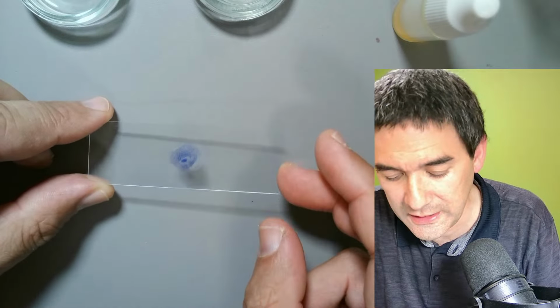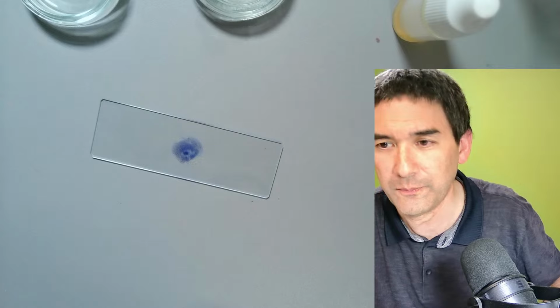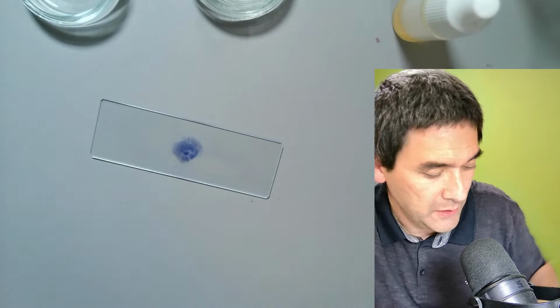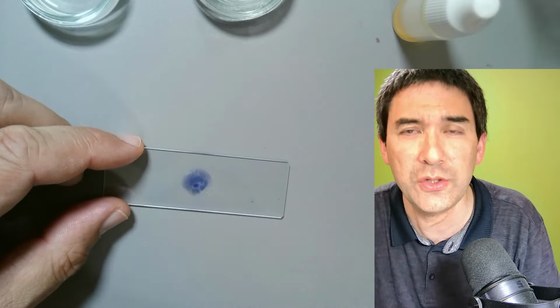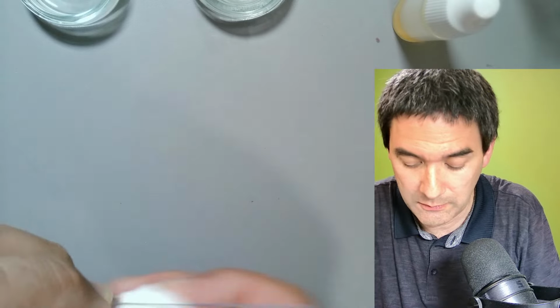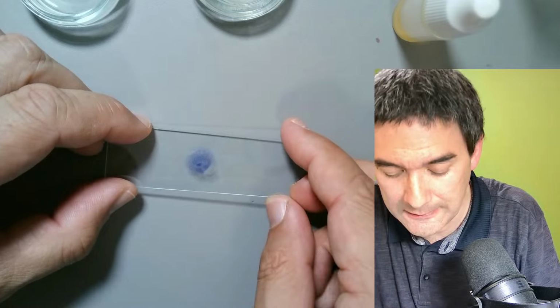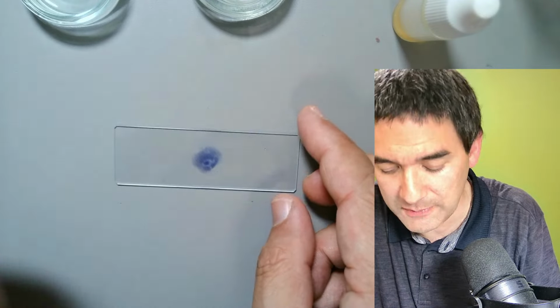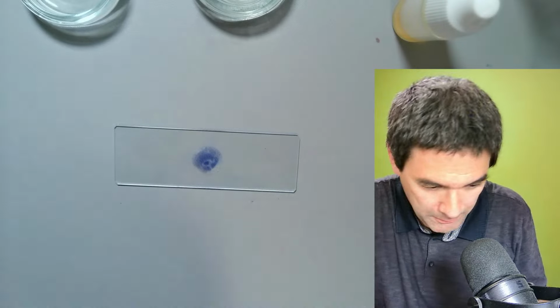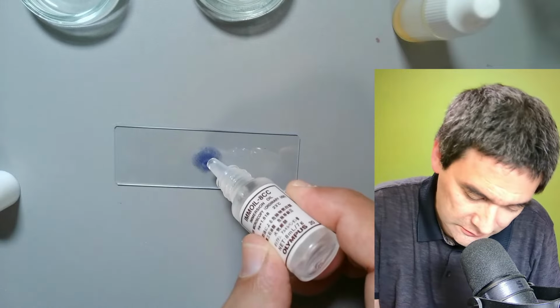Maybe I'm just going to try it anyway. And this should actually also work. Yeah. This is something that, when I learned it the first time, was also kind of new to me. You can actually use this without cover glass. Yeah, this was actually the standard procedure that we used. I'm just checking again. You see there's still a small speck. It doesn't matter, it's just for demonstration purposes. I need to find my bottle of immersion oil again here. I apply it directly on here.